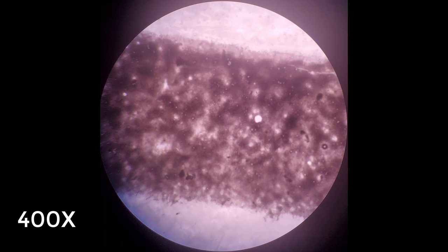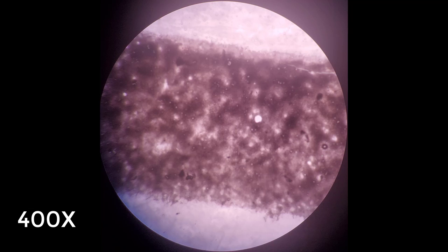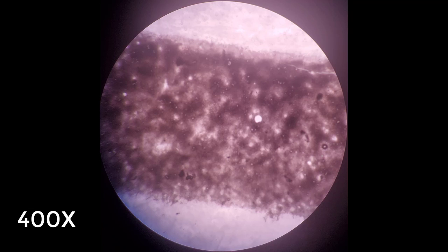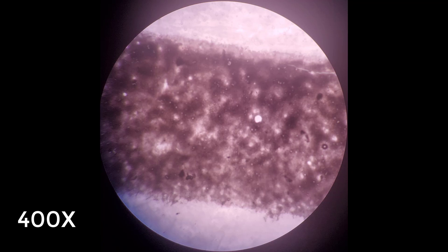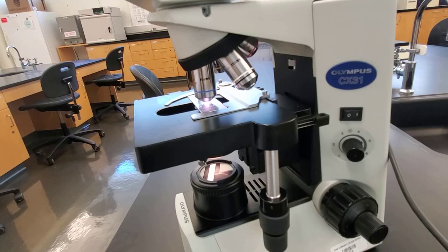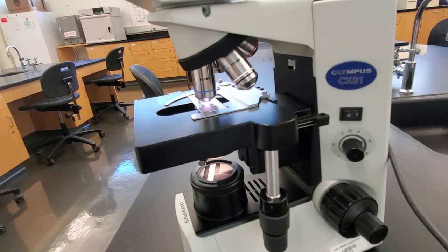At 400x total magnification, I don't see the whole E because I am so zoomed in that I only see a part of it. I can see much greater resolution and more detail in the ink, but the field of view is now very small.